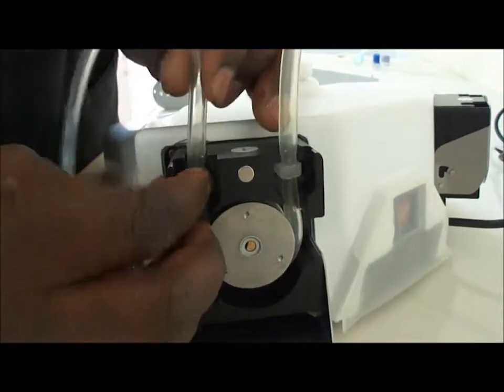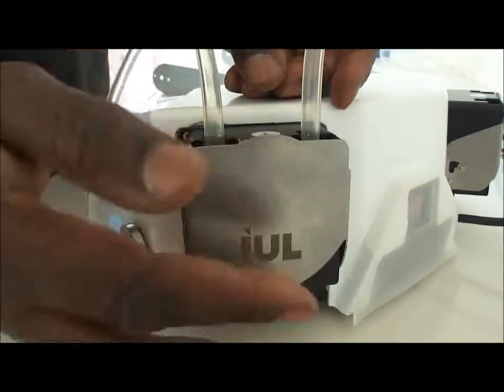Then we insert this in the top here and just close this.